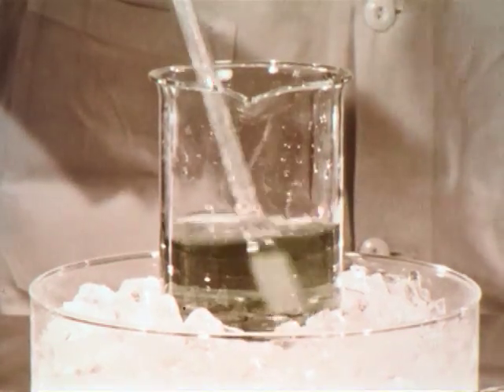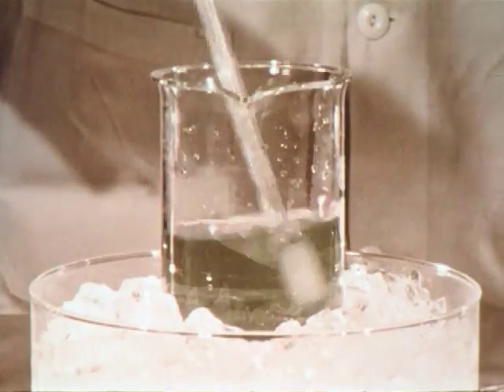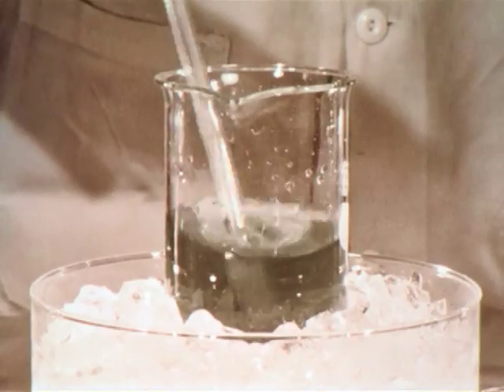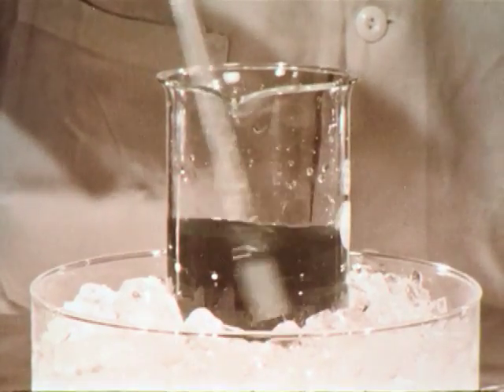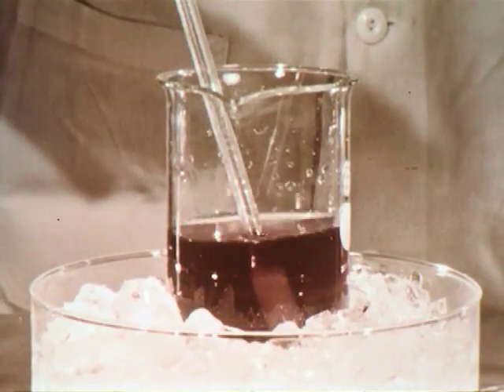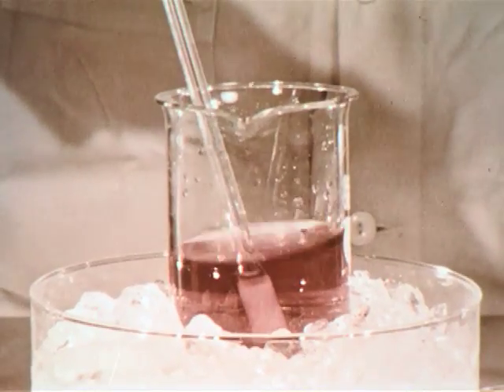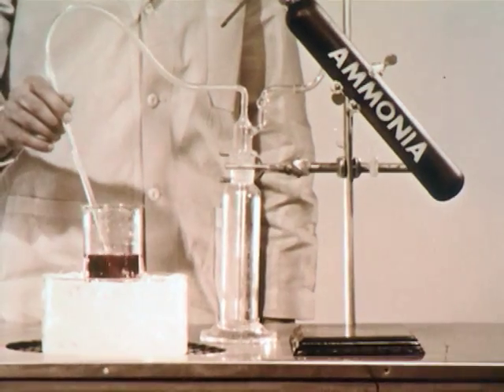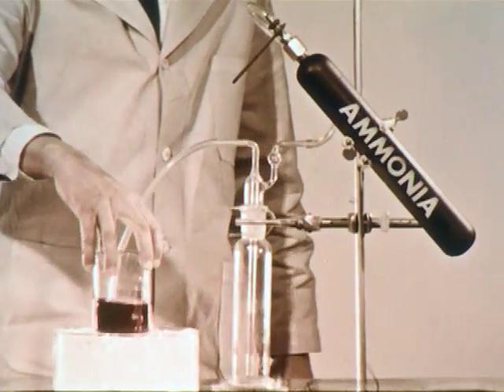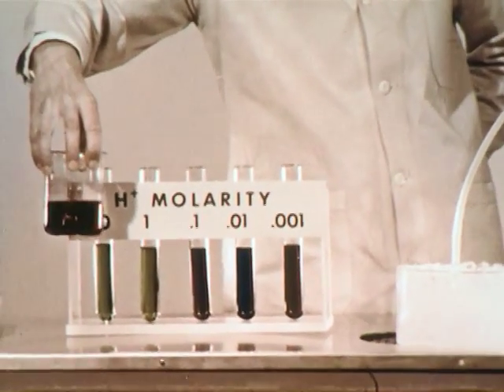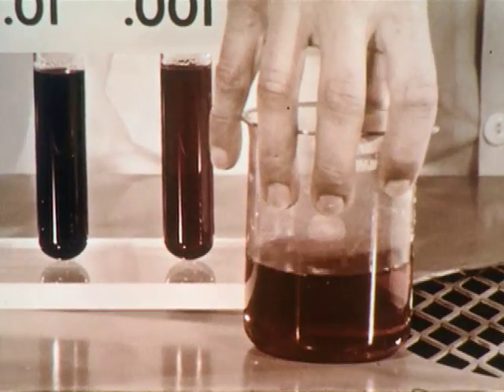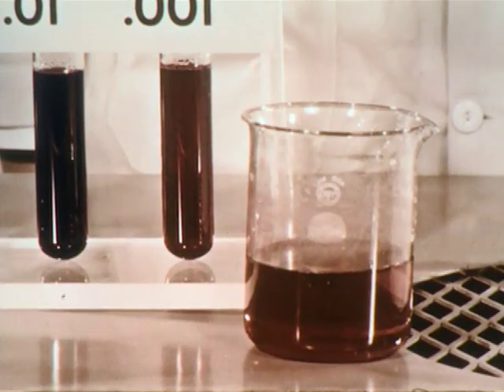As more and more ammonia is introduced, the acidity continues to drop. The methyl violet changes through the intermediate colors, finally becoming violet. Let's compare our product with the known indicator colors. We see that the final solution, ammonium nitrate, has a hydrogen ion concentration of one one thousandth molar or less. Few loosely held protons are present. The acidity is low.